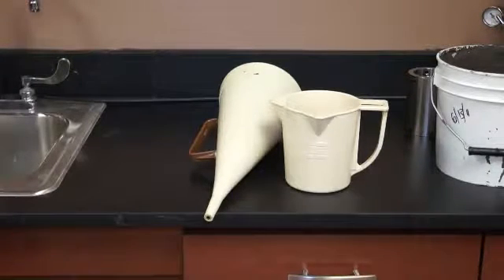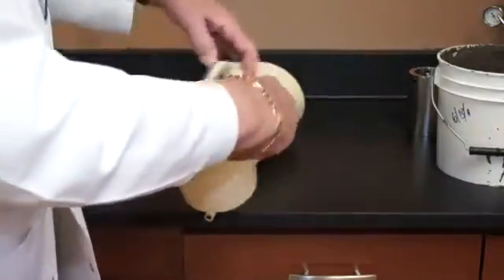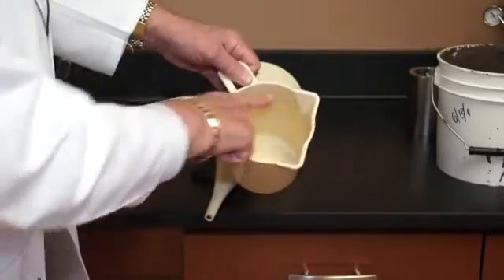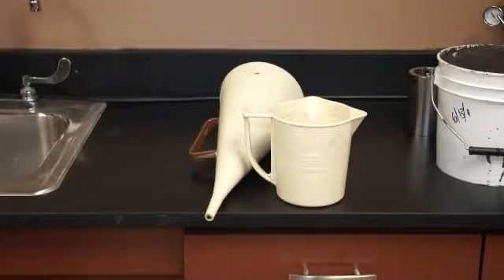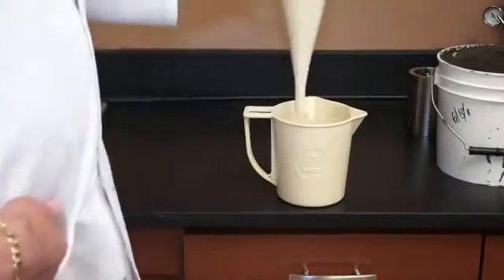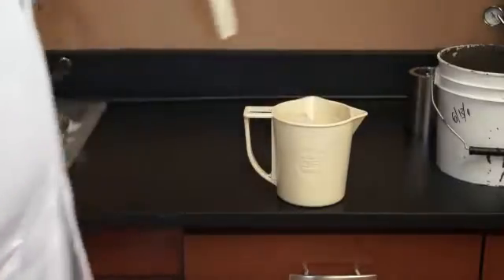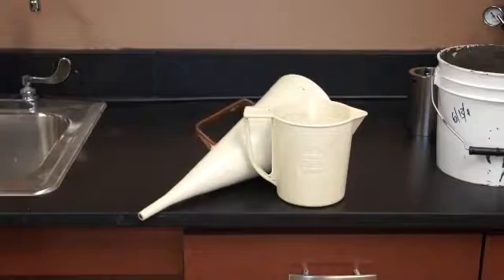Basically, you're timing how long it takes 1 quart of liquid as measured by your measuring cup here. There is a line here at the top that maybe you can see, and that is a 1 quart mark line, or 946 milliliters in metrics. Using the quart as a measuring device, you measure the time it takes to fill this cup up to the quart line. That is the end of the test as such.